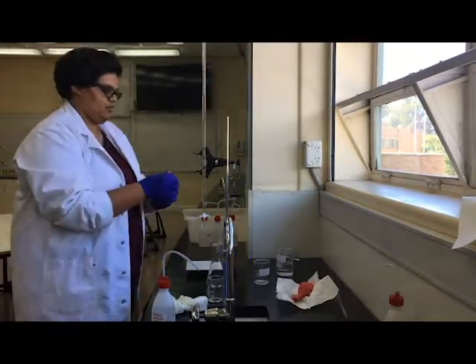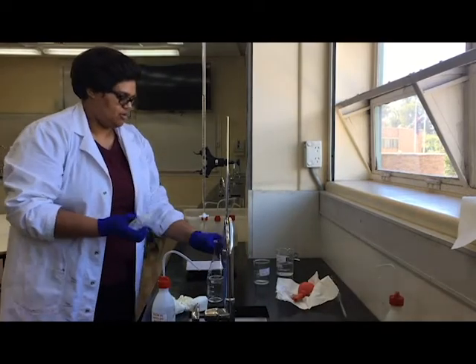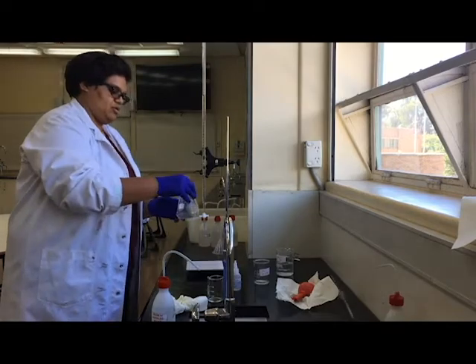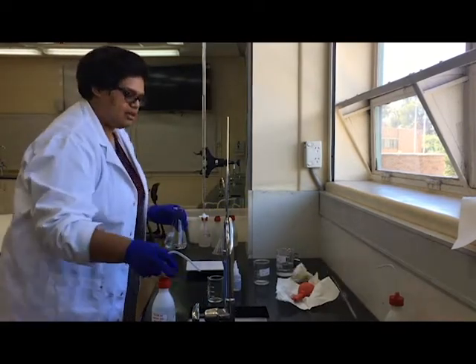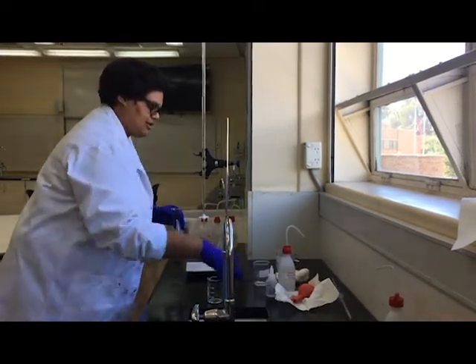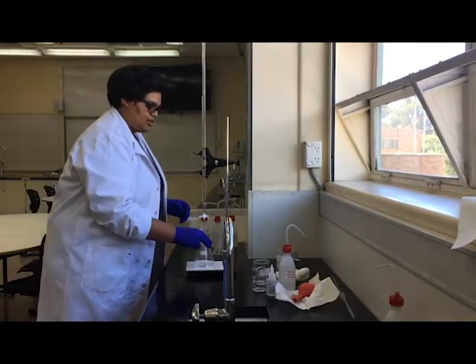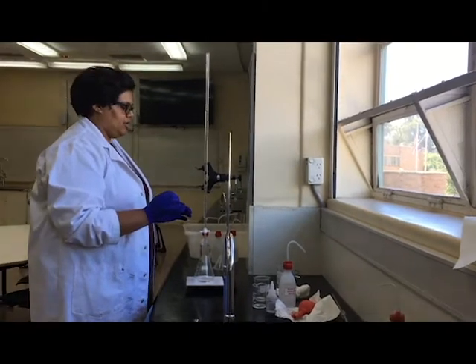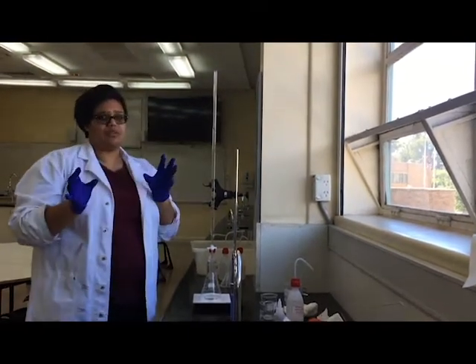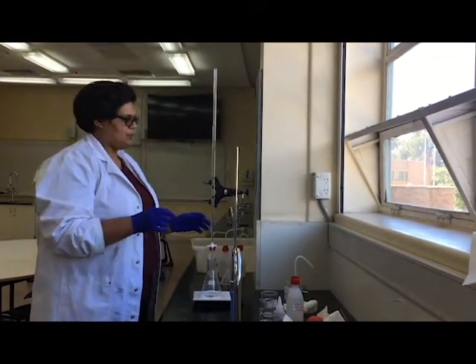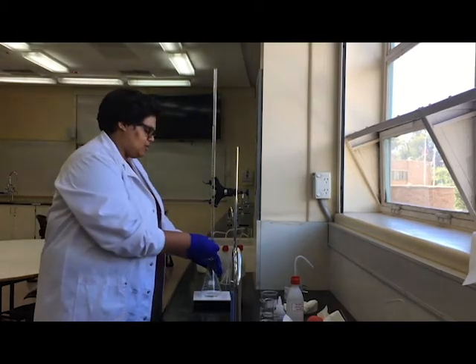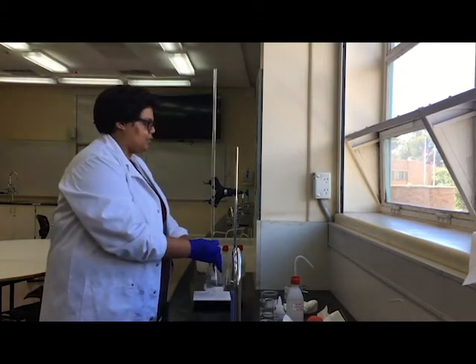Okay, so I've got my conical flask ready to go. Swirl it around, get the paper out of the way. And I'm gonna go again. So this time I'm starting at same as before, 13.8, so I can approximate there's going to be around 13 mils. So I'm probably going to put 10 mils to start with really fast and then go really slow from there.